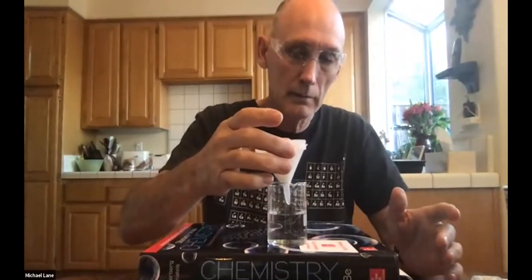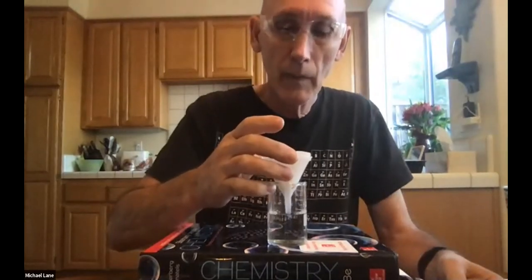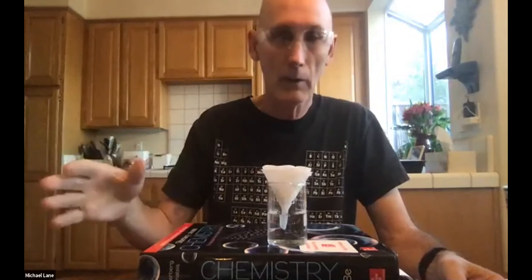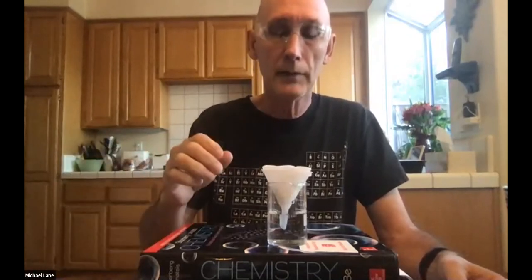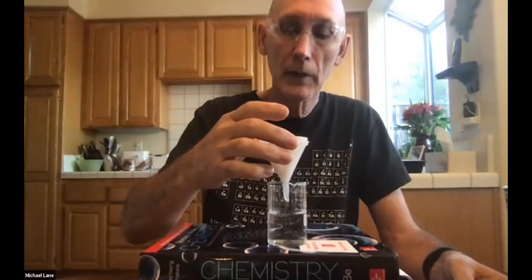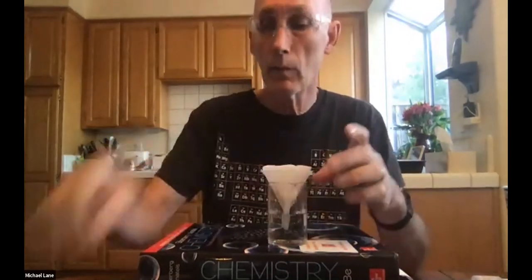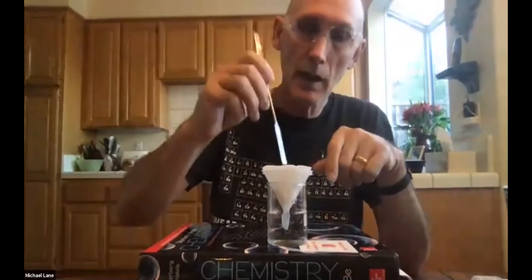Okay. Still just a tiny bit left in there. No sense to rush it now. Just another drop or so. If you can, I'd recommend you get to this point, clean up everything else, make your notes in your notebook and let this filter for as long as possible. The procedure, I think, says 15 minutes. That's certainly enough.